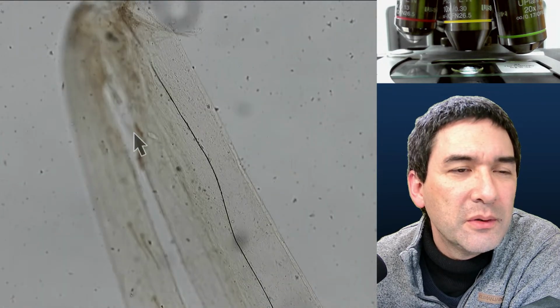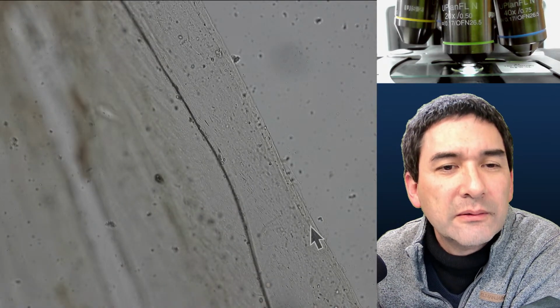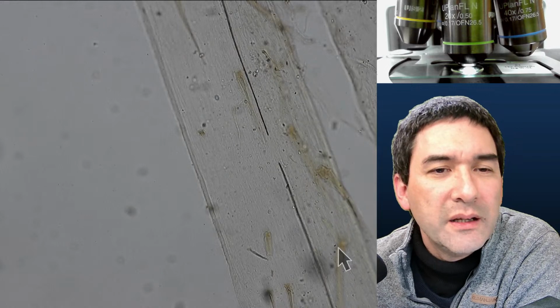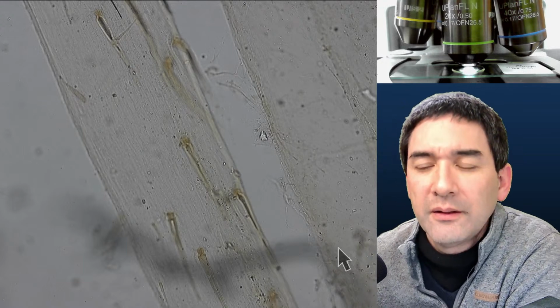Let's go up a little bit with the magnification. Let's get the arrow out of the way here. I've seen more interesting insect legs. And it does seem to be quite empty. Maybe during the preparation they have removed the contents of the leg.